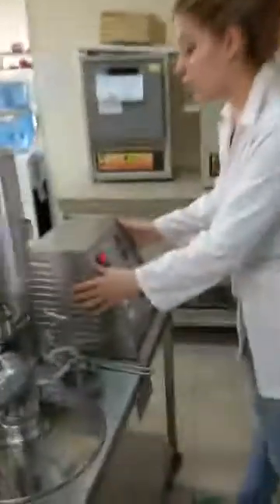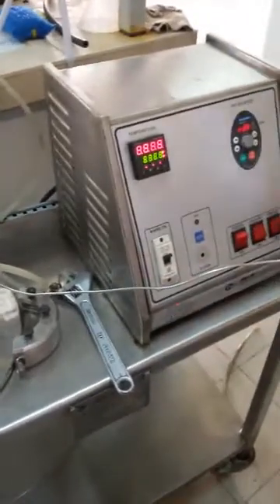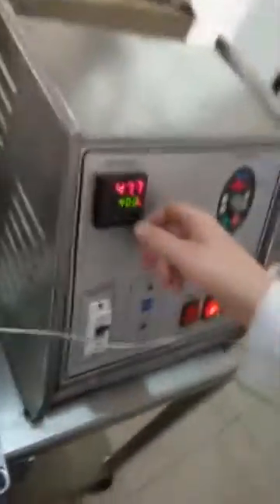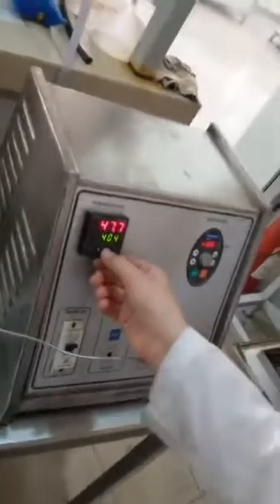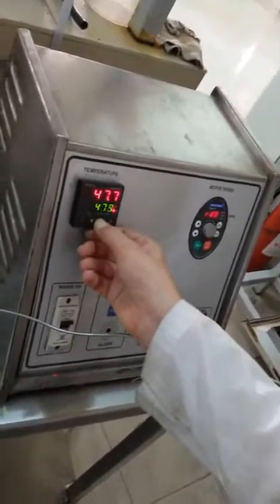This is the main control system. I have here the on/off switch. This turns on the motor. This turns on the cooling, or for putting water — like that. And this turns on the heat, for my own experiment. I want to raise the heat to my desired level.